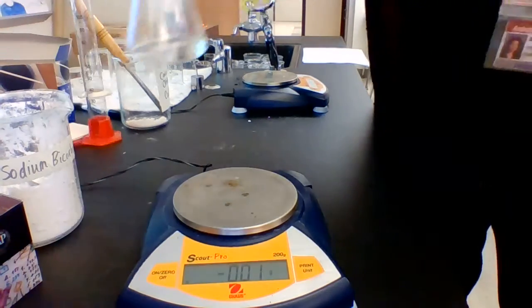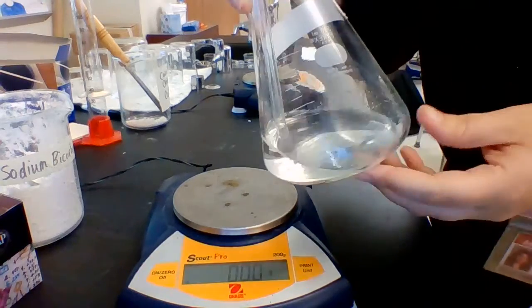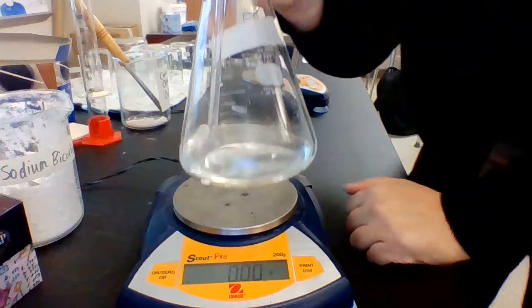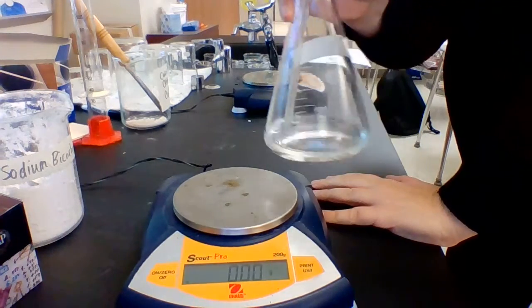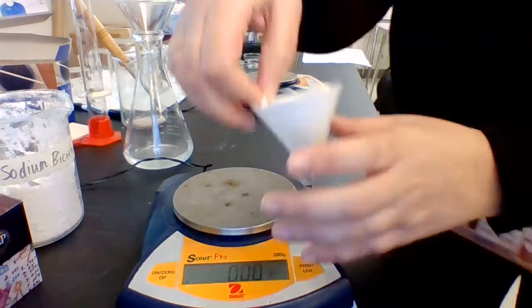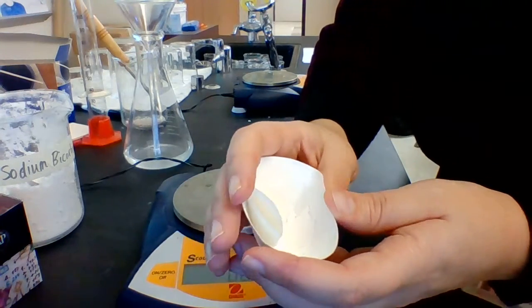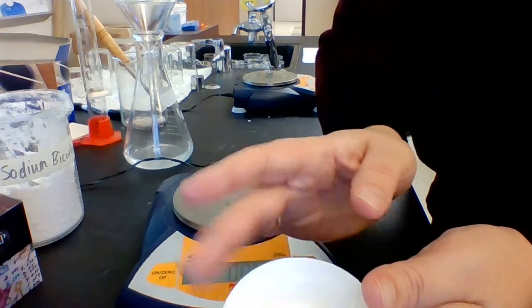Okay, so when we do the reaction, we collected the substance in the filter paper and the liquid drained through. If your liquid turned out to be cloudy, that's because it did not fully react before you filtered it. So that excess was in there. So anyhow, I'm going to pull this out. It's now completely dry. You can hopefully see that the precipitate, it's a white substance, and it's in here.